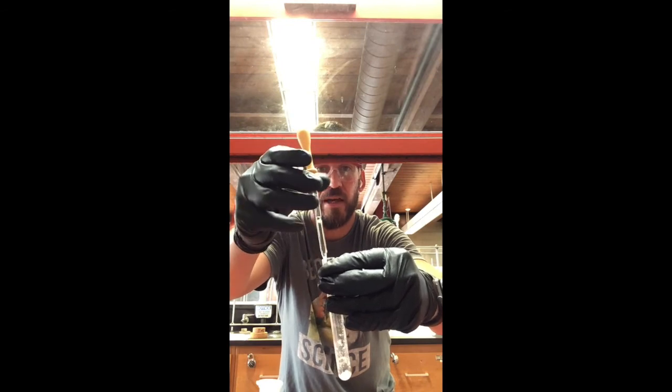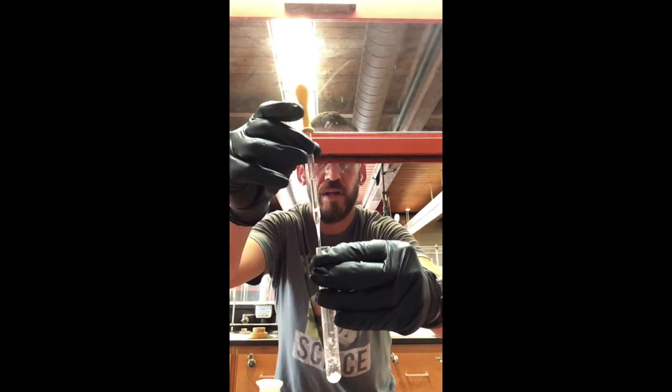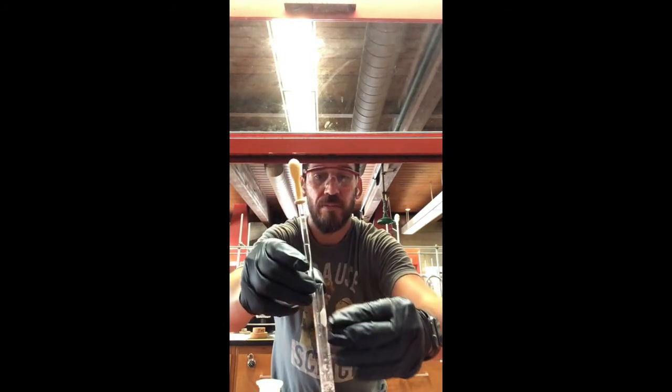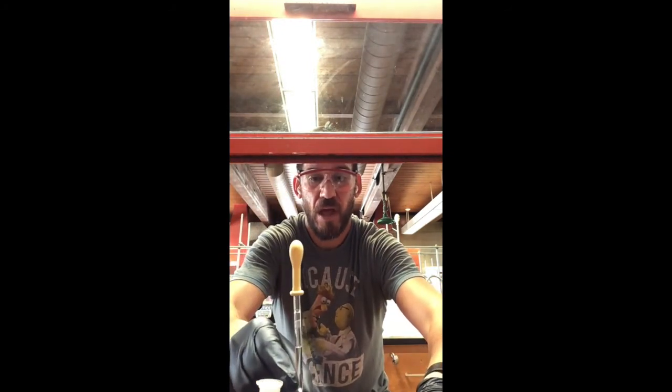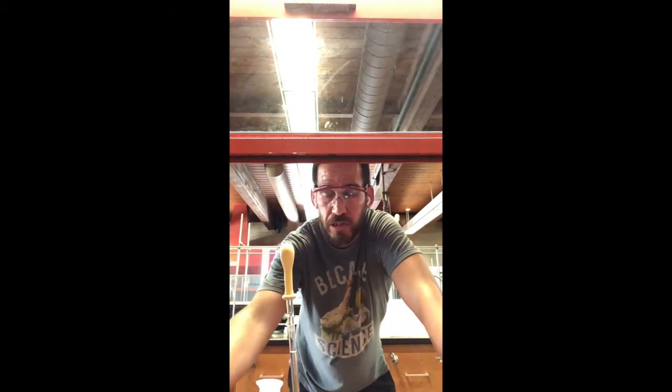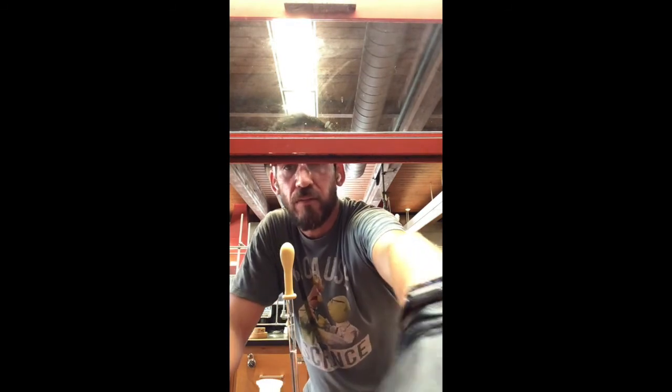Oh, look at that. Bummer. Look at all that sodium sulfate I got. Whoopsie daisy. So that's going to happen. And so what I want to do is show you how to set up something called a pipette filter. Okay? So let's check it out.